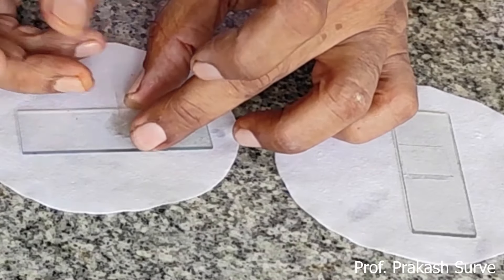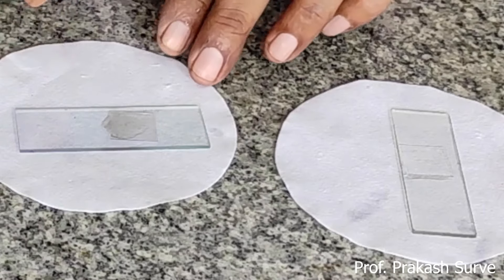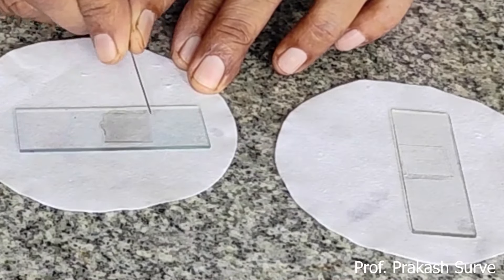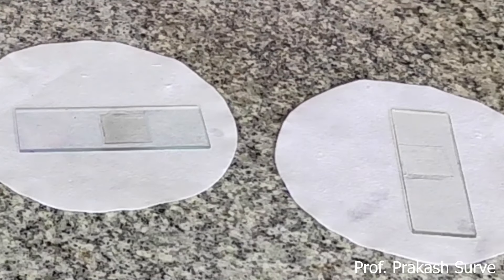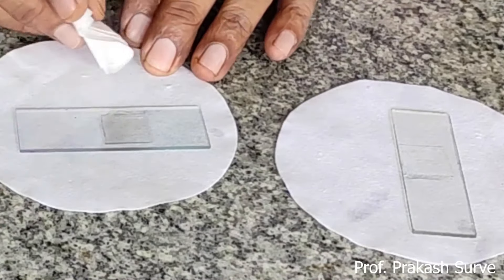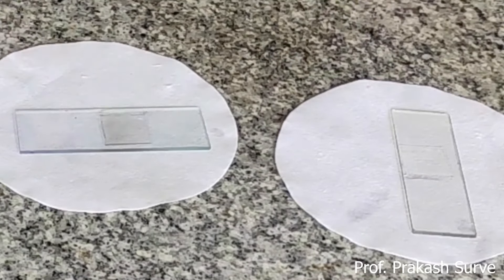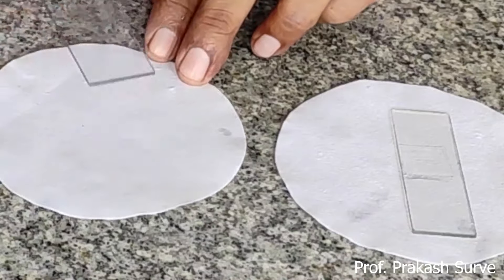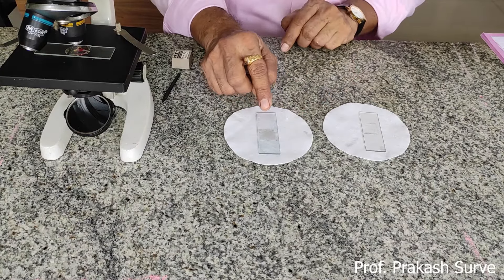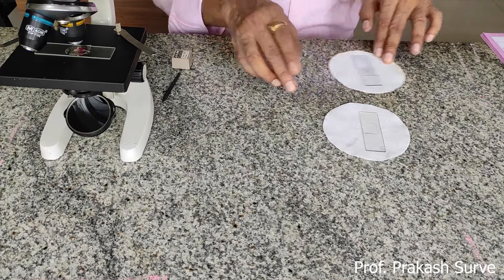Follow the same procedure for the unwashed leaf slide — put the cover slip on it, use the needle to slowly release it, and keep the cover slip at the center. Remove excess glycerin with filter paper. Now our two slides are ready: one slide of the washed leaf and one slide of the unwashed leaf.